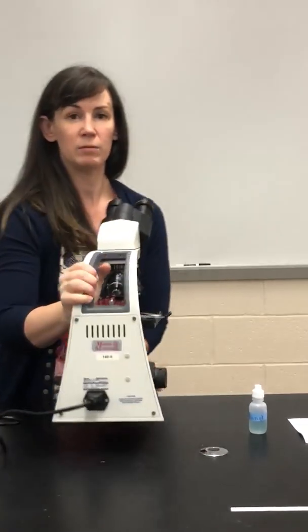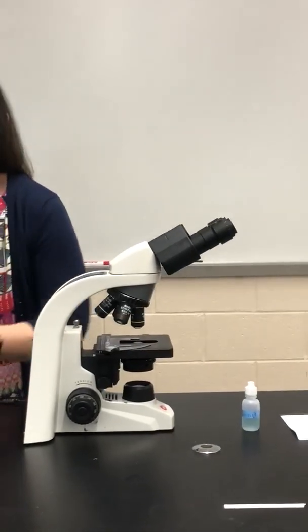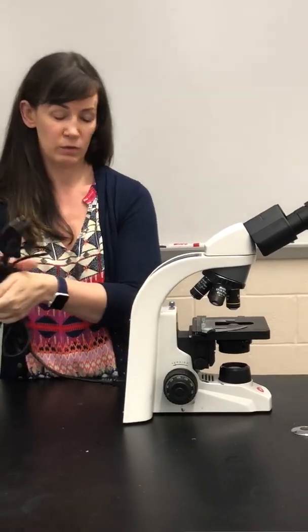Likewise, if you do need to move your microscope on the table, pick it up and move it. Don't drag it across. That will shake things loose in the microscope and it will mess up the view that you're trying to see. When you plug in your microscope, always make sure that you actually hold the plug itself, that you don't just yank the cord of the microscope. Carefully plug it in and remove it.